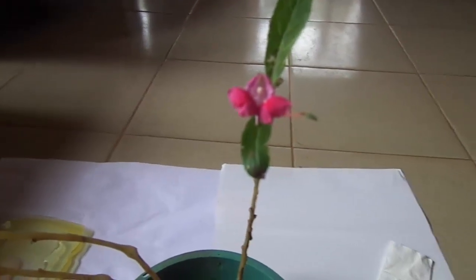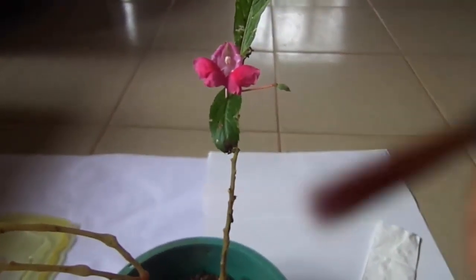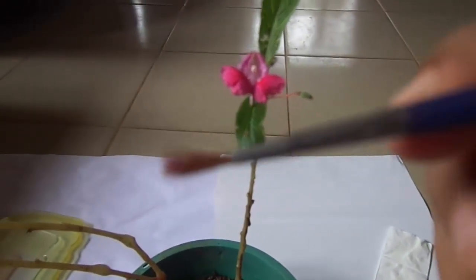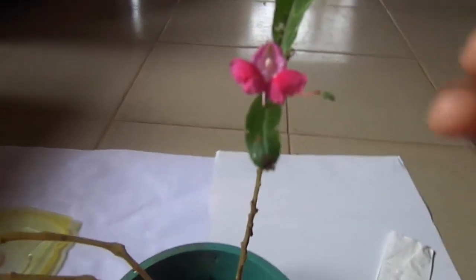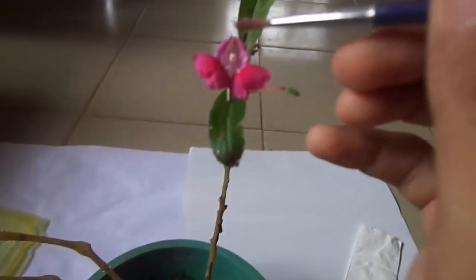Next is the cross-pollination. For that, we use a small elegant brush to take pollen from the pink flower. The pollen has a white color, dust-like appearance.